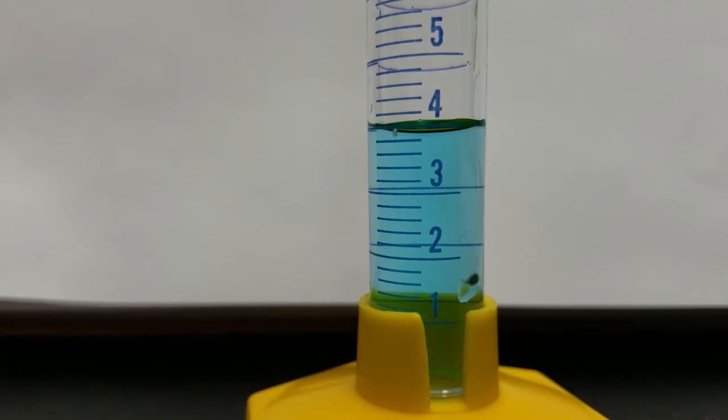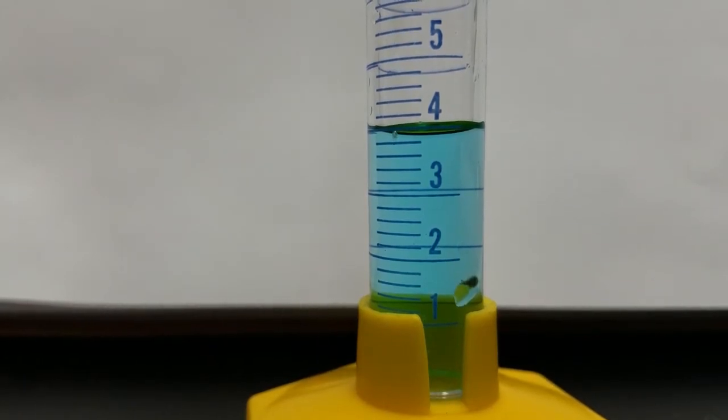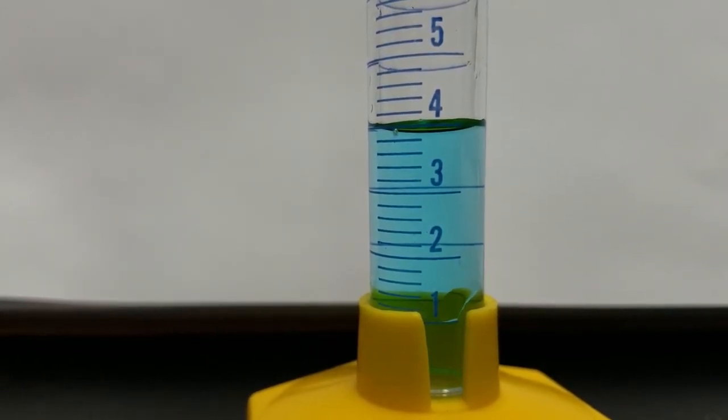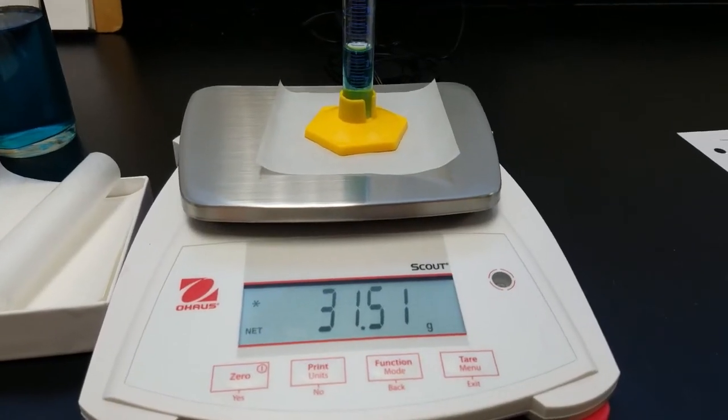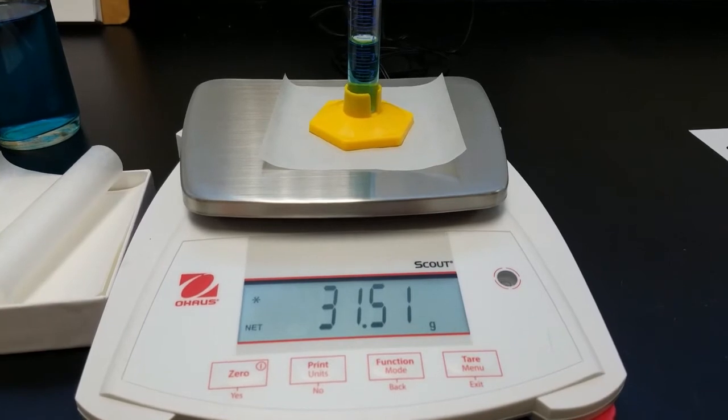An additional two milliliters has been added. Record the volume. The mass of approximately four milliliters of water.